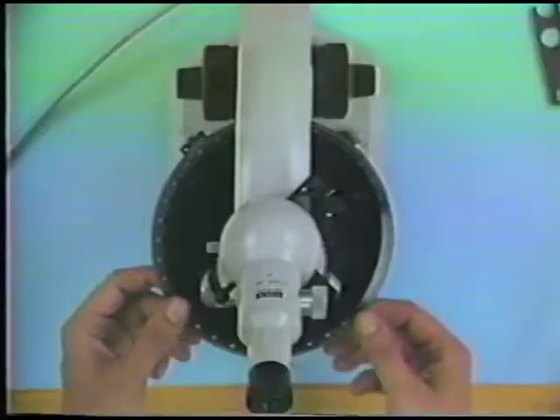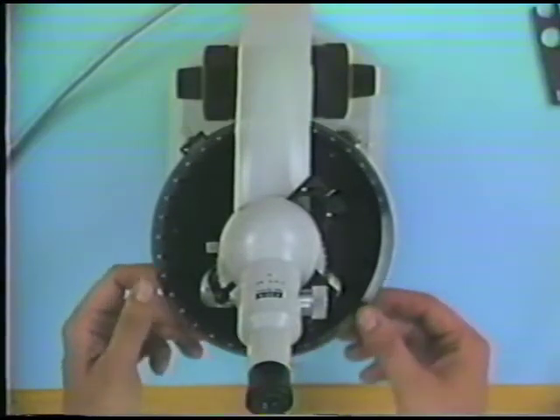The grains, and see as I rotate the stage, these interference colors will change, and that's because, of course, the slow rays are rotating. Slow and fast ray, their angular relationships are rotating. So individual grains change their interference colors depending on whether the slow ray is parallel or opposite to the slow ray in the accessory plate. The blue grains then represent those grains which have slow rays parallel to the gypsum plate. The yellow grains represent those grains which have slow rays opposite to the gypsum plate.